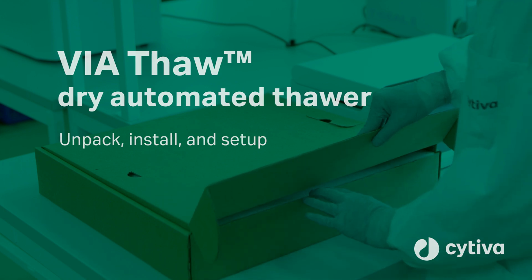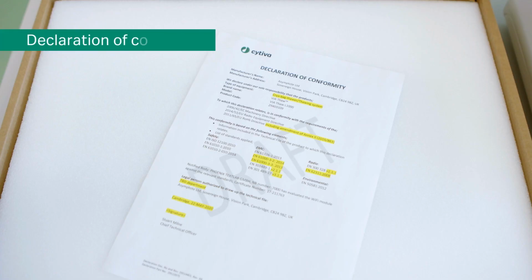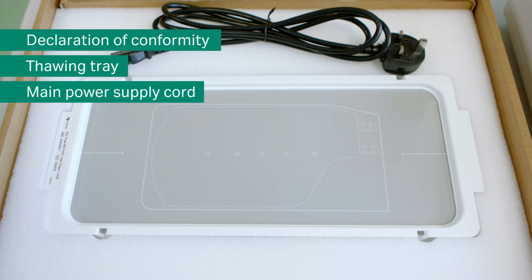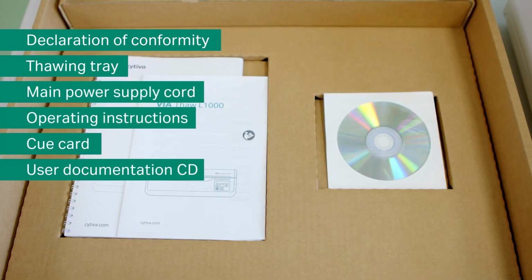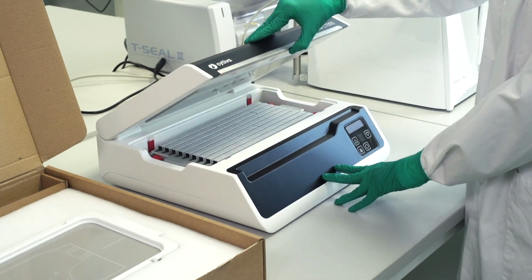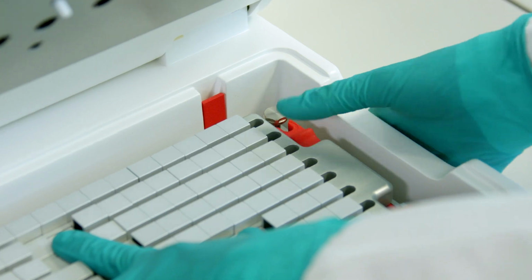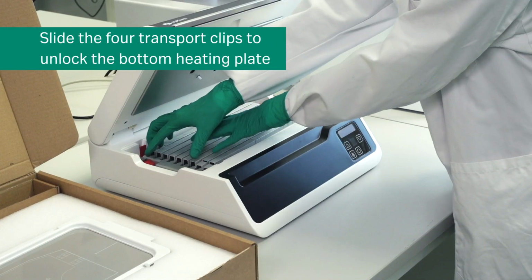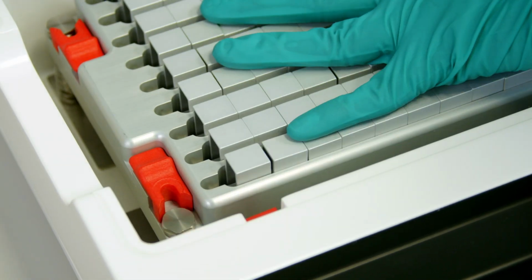Before installation, verify that the product box contains all expected items. If any of these items are missing or damaged, please contact your local Cytiva representative or authorized distributor, and do not use the instrument. To begin, first install the thawing tray. Open the lid of the instrument. Slide the 4 transport clips to unlock the bottom heating plate. The bottom heater plate will lift to the top.